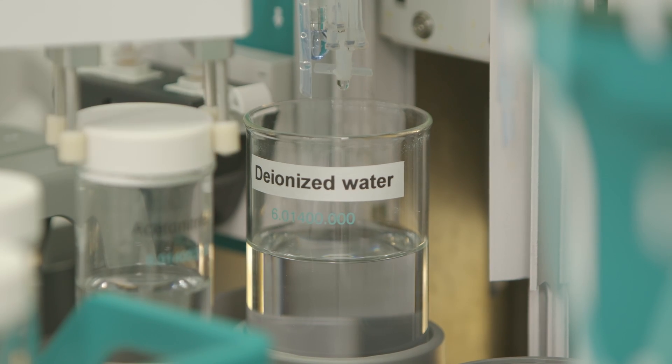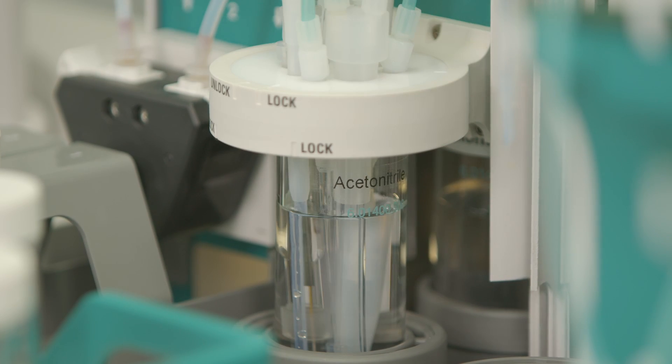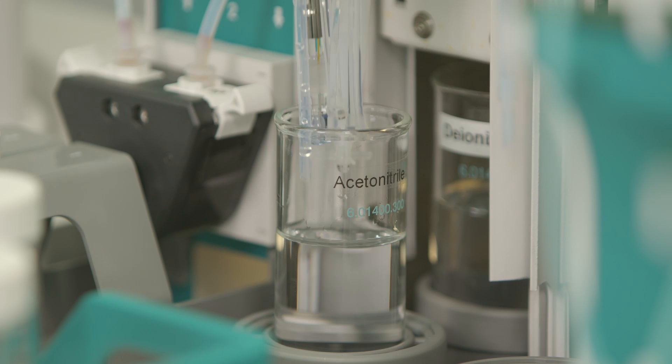Afterwards, the electrode is again dipped into acetonitrile to remove any excess water. Fully automated determination of the hydroxyl number according to ASTM E1899 and EN 15168 with an Omnis sample robot from Metrohm is fast, accurate, and reduces exposure to chemicals to a minimum.